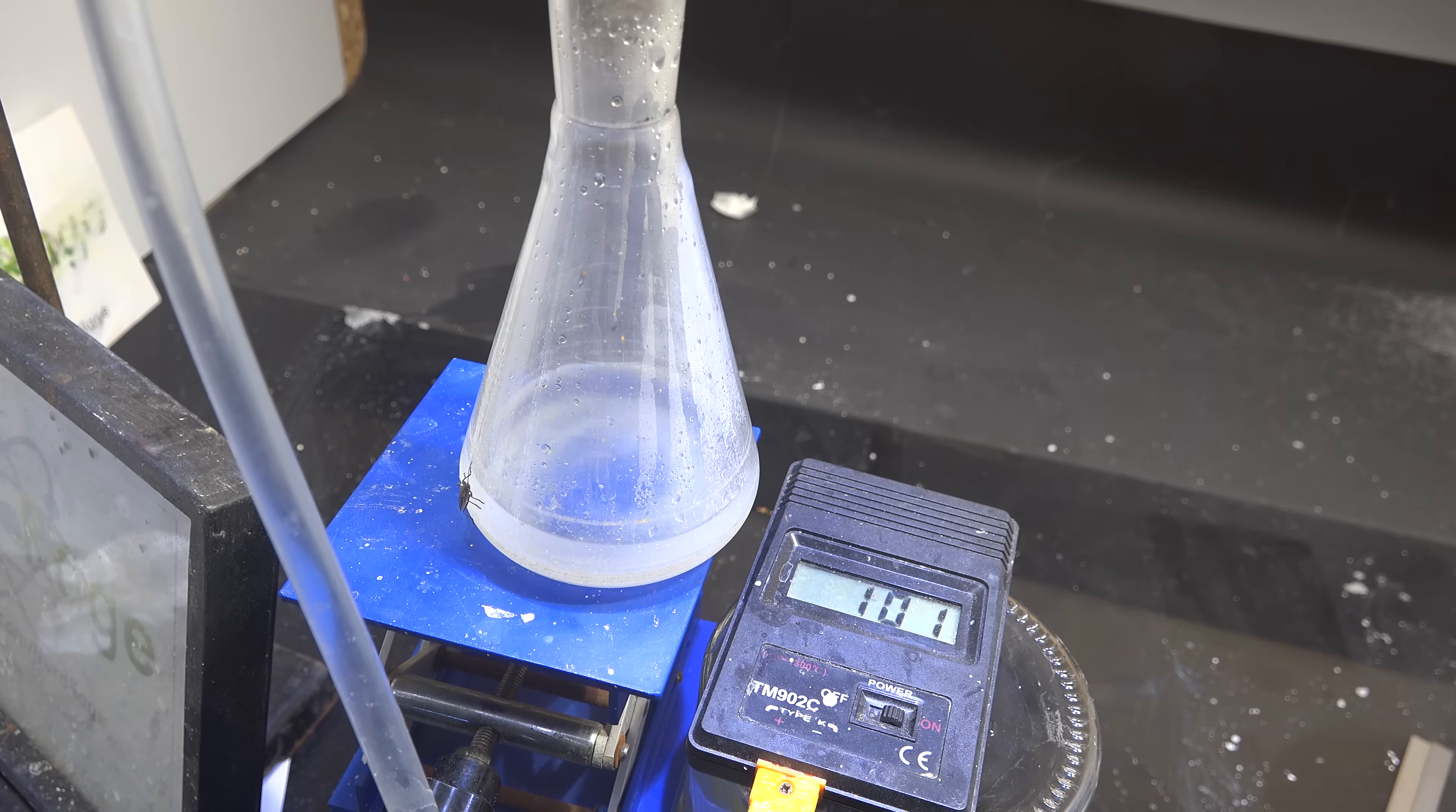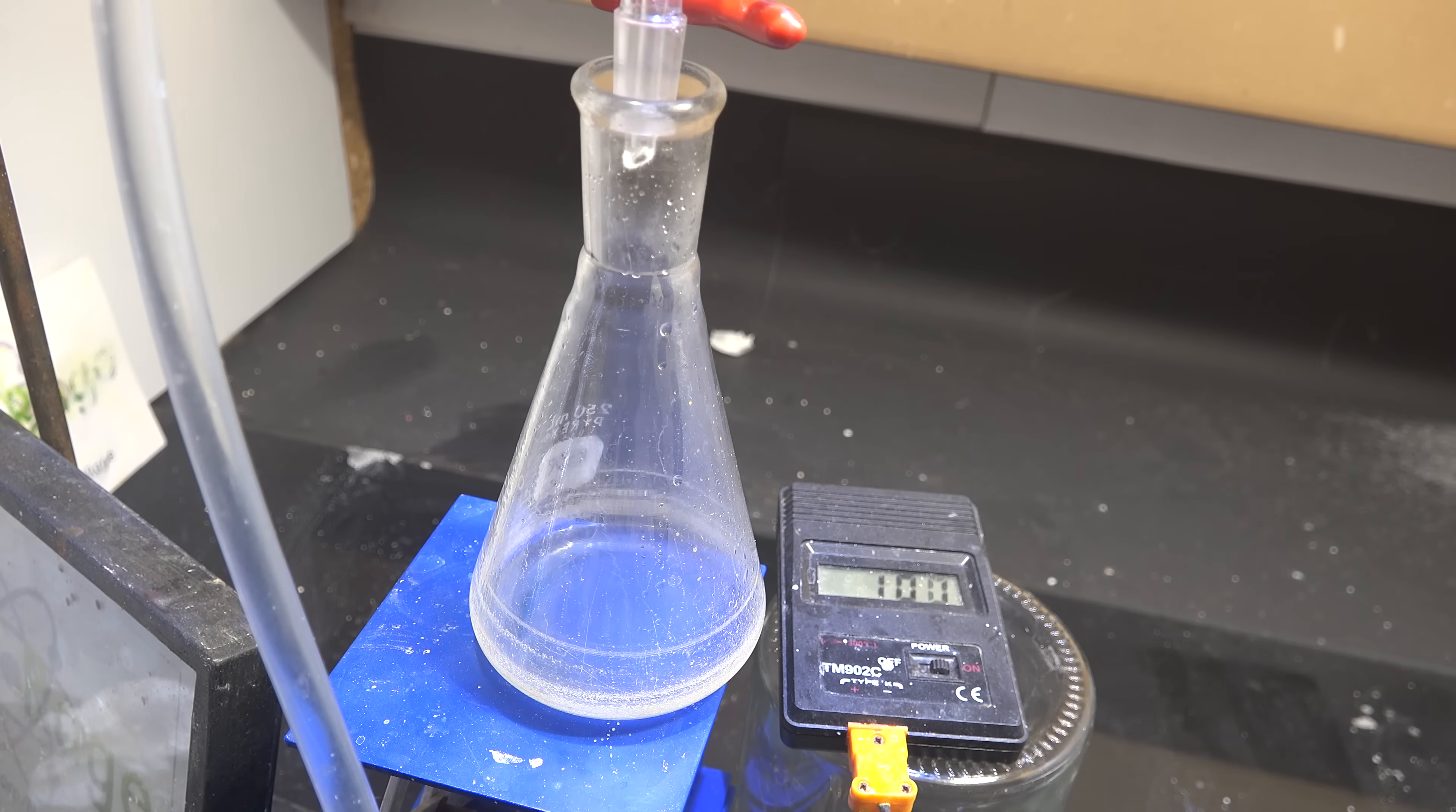Ah crap, I got a bug here. Okay bug, I'm going to call you Gary. I'll give you 20 bucks if you don't do what I think you're going to do. No? No? No? Ewww. You just lost 20 bucks Gary. Okay, let me pour the distillate back in and start all over again. And here we are again.